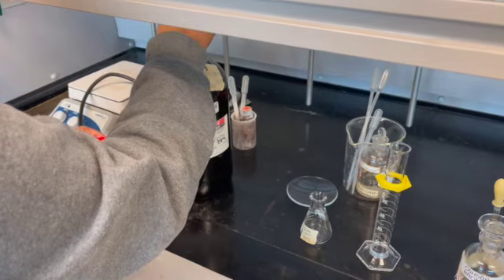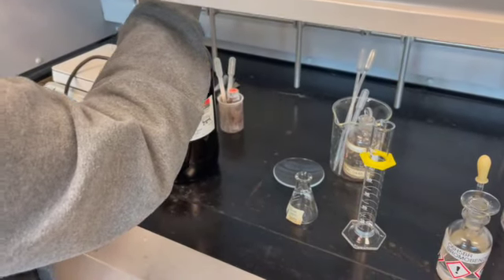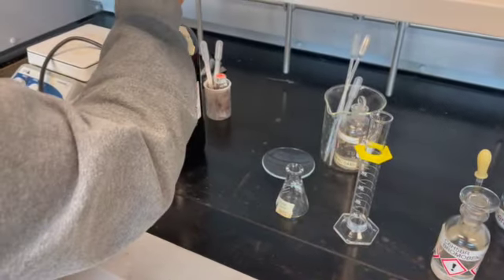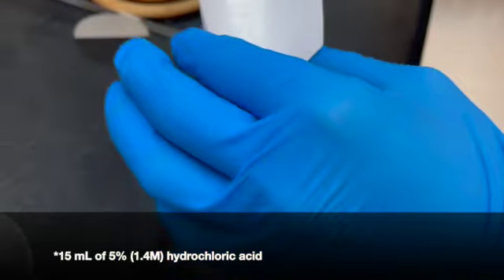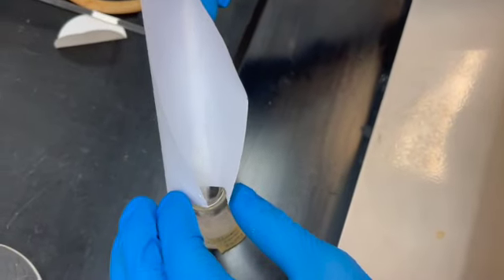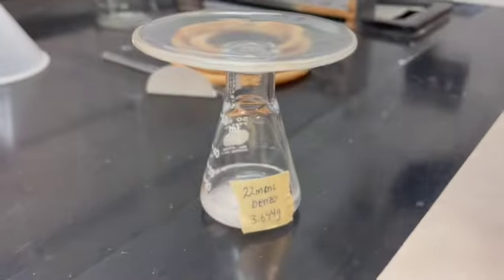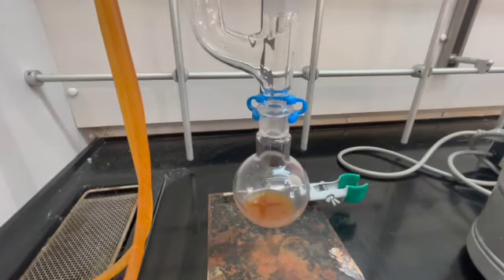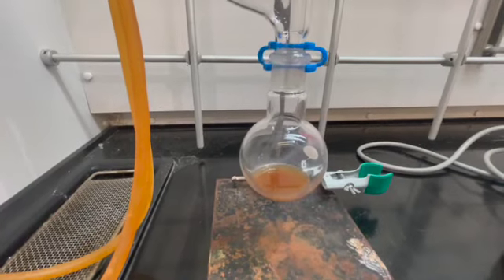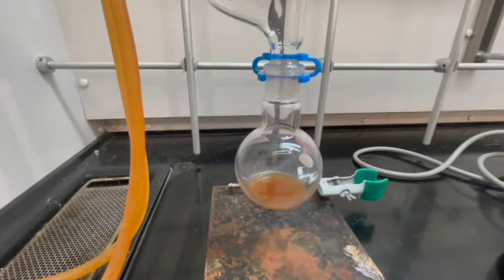We're placing 10 milliliters of diethyl ether inside the cylinder to then place inside the flask, in which we will stop it with the watch glass so the vapors won't escape. Now we're going to place our solid within our solution carefully and close it up with the watch glass. After we take this off the heating mantle, we hope for as much of the magnesium to dissolve as possible.